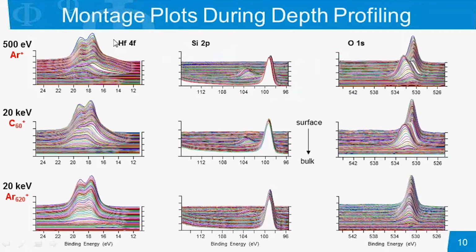One thing we can see right away is that for the hafnium, we do see this broadening to the lower binding energy side, indicating damage. And if we compare between the monoatomic argon, the C60, and the GCIB, there is a decrease in this damage as we go to lower eV per atom energy, with the lowest eV per atom energy, in this case, being the argon cluster profile.